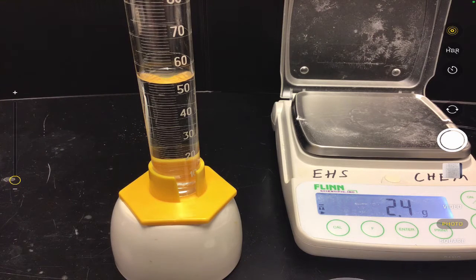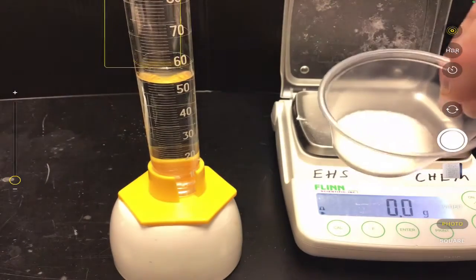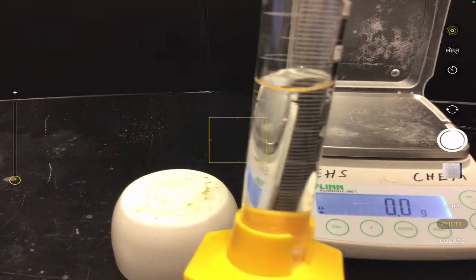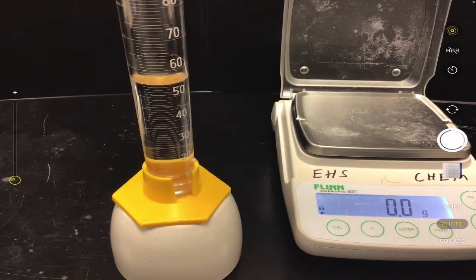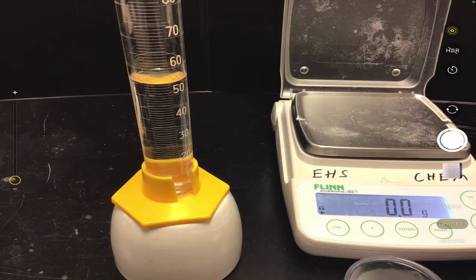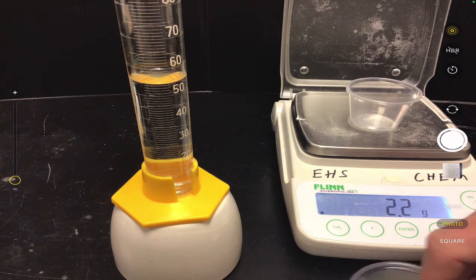So here's what I got going on. First of all, I have a balance out here that's set to 0, and I have a cup of sugar, okay? And I want to take this sugar and dissolve it into this water right here. And when I do that, I'm going to create a sugar solution, and that sugar solution will then have a certain concentration to it, okay? So to do this, I need to, first of all, figure out the mass of my sugar so I can find that numerical value of the concentration.